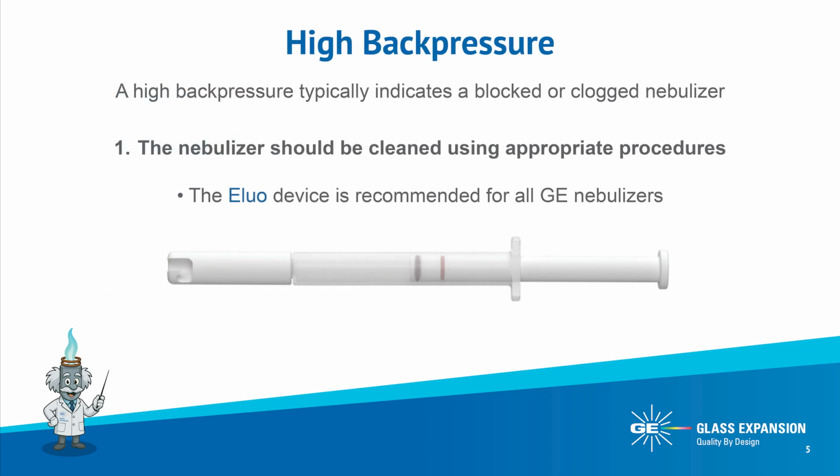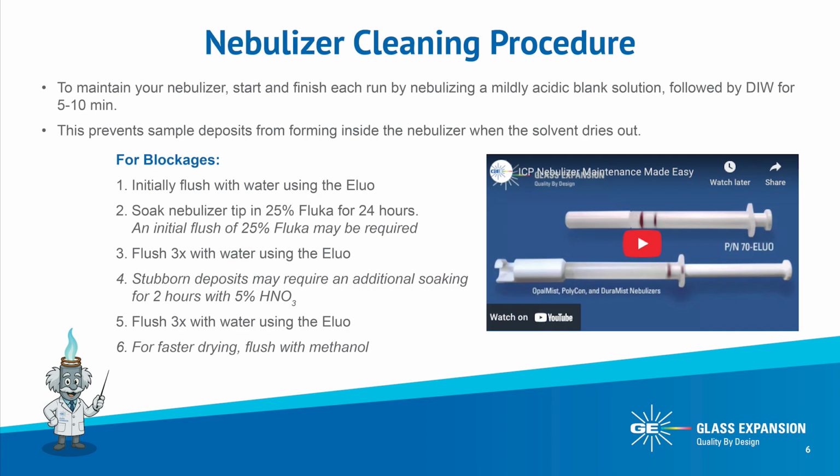Now, if your backpressure is higher than your benchmark, you're likely dealing with a blockage or clog. To address this, remove the nebulizer and clean it carefully with the recommended reagents and tools, not only to ensure proper cleaning, but also to prevent any damage to the nebulizer. The Eluo device is the recommended cleaning tool for all glass expansion nebulizers. Regular maintenance keeps your nebulizer performing at its best and maximizes its lifespan. You'll find detailed cleaning guides and videos on using the Eluo on the Glass Expansion website.